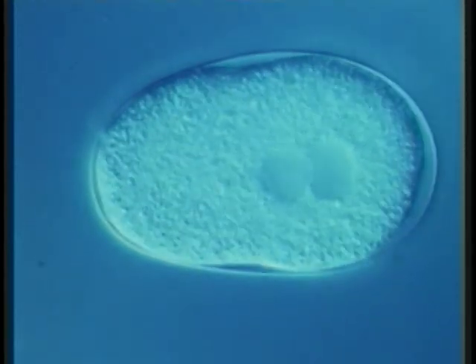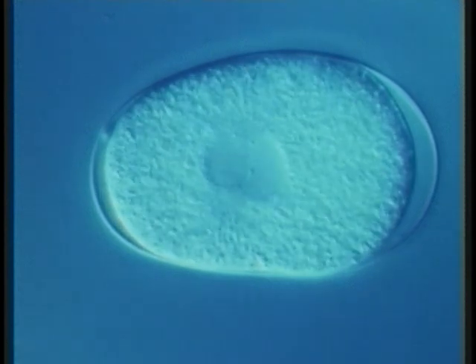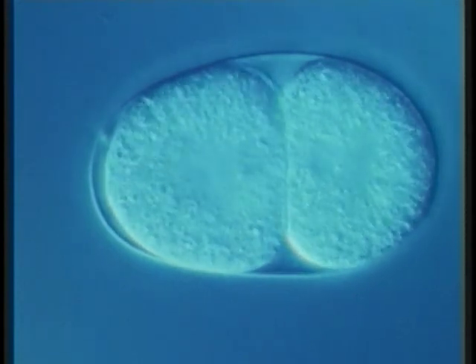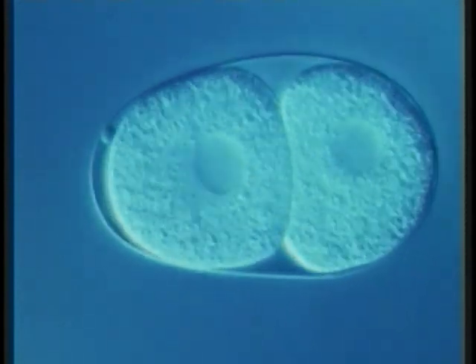This speeded-up sequence shows embryonic development of a nematode worm within an egg. The sequence starts with the two nuclei fusing — fertilization — and proceeds with the subsequent cycles of cell division that give rise to the worm. This organism goes from a single cell to an adult with 1,000 cells in about three days. Since the worm is transparent, the fate of each cell in the developing embryo can be followed.